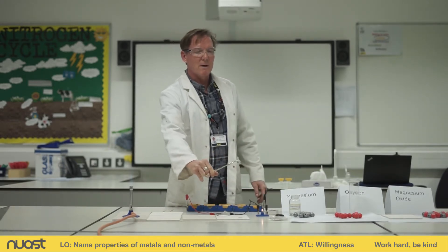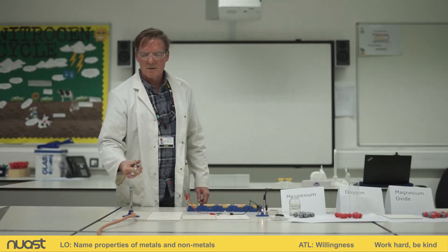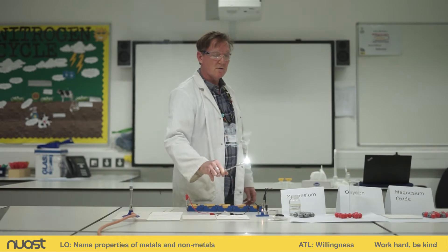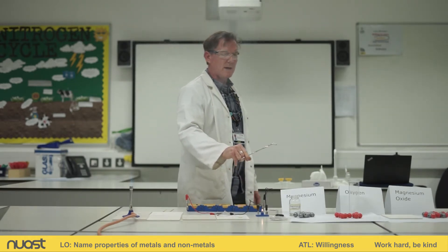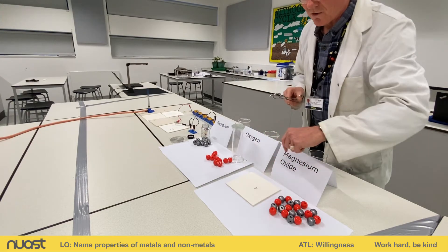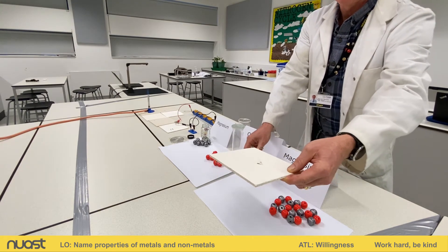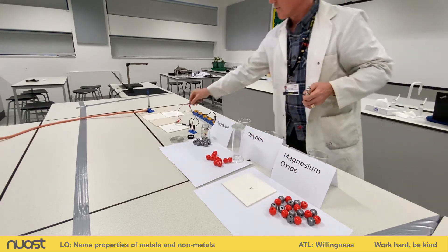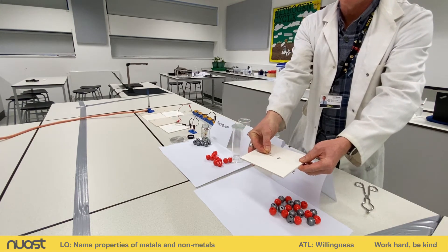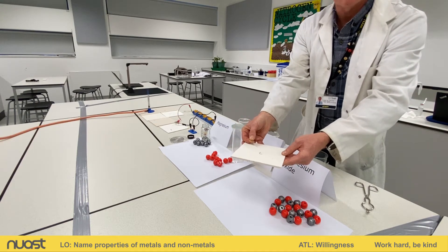I've attached my magnesium to the tongs — here we go, I'm going to light it. And there you go — a nice bright white light with lots of smoke given off. We've made our compound, magnesium oxide. I've just placed it onto the heatproof mat and you can see it's a white solid. You can see it's different from the original magnesium. The magnesium was silver in appearance, shiny silver like you'd expect for a metal, but our magnesium oxide is now a white compound.